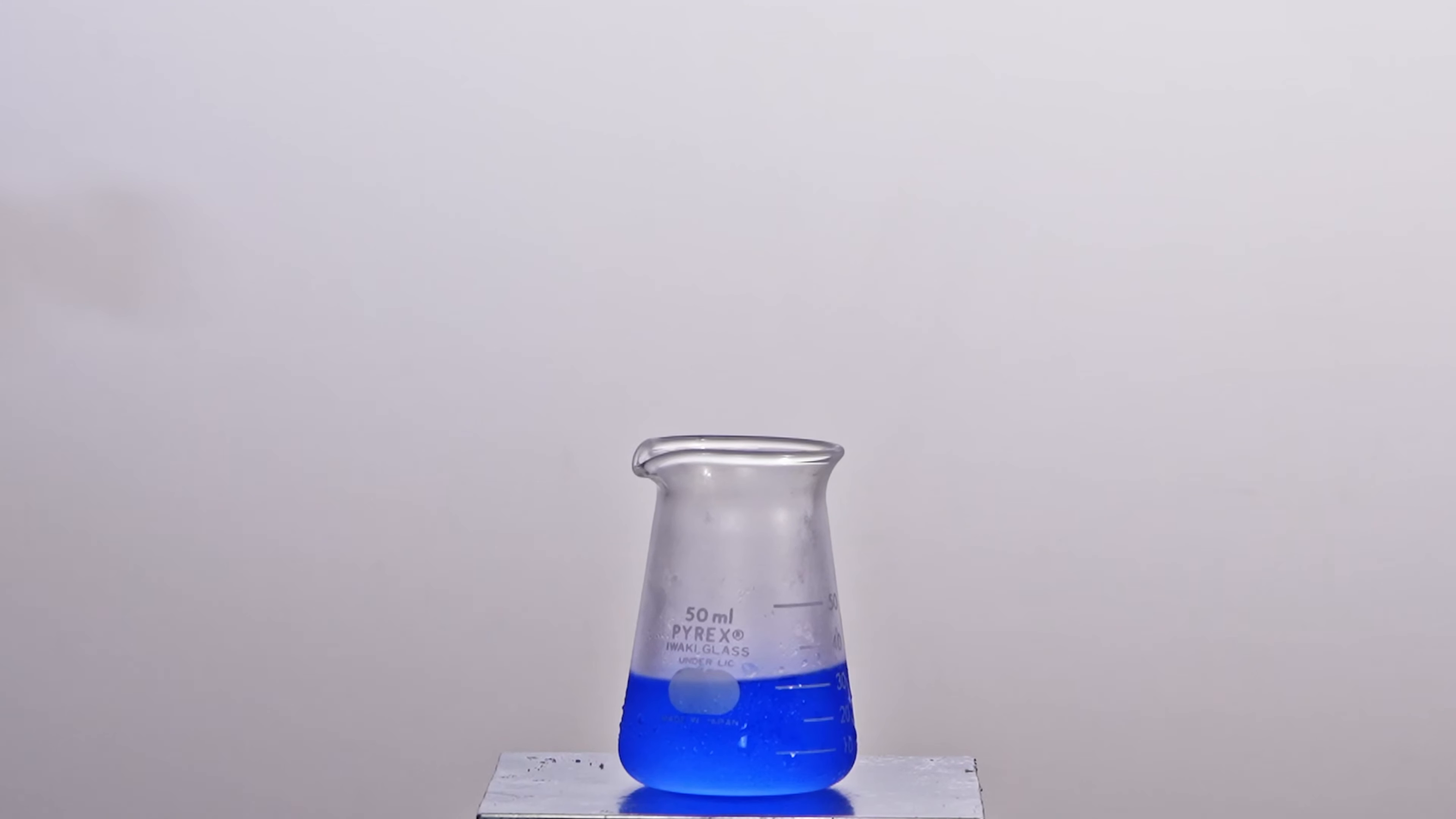Next, I tried making the most concentrated ozone solution possible. Look how deep blue it is.